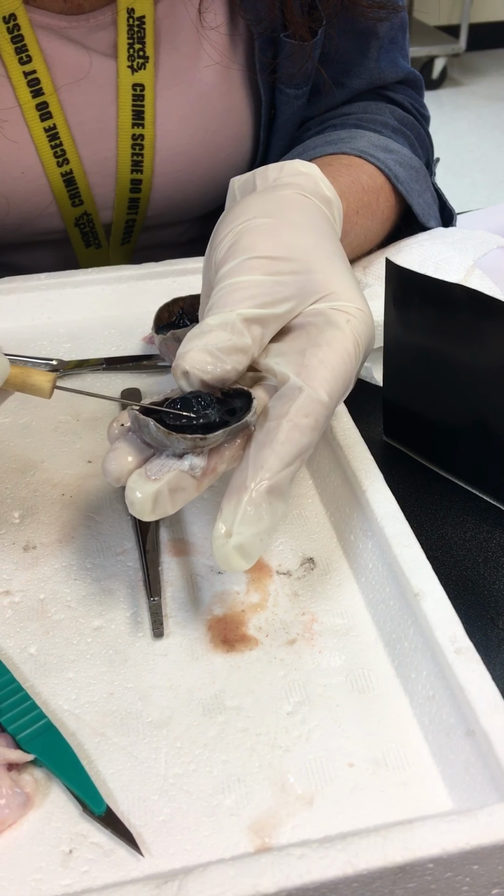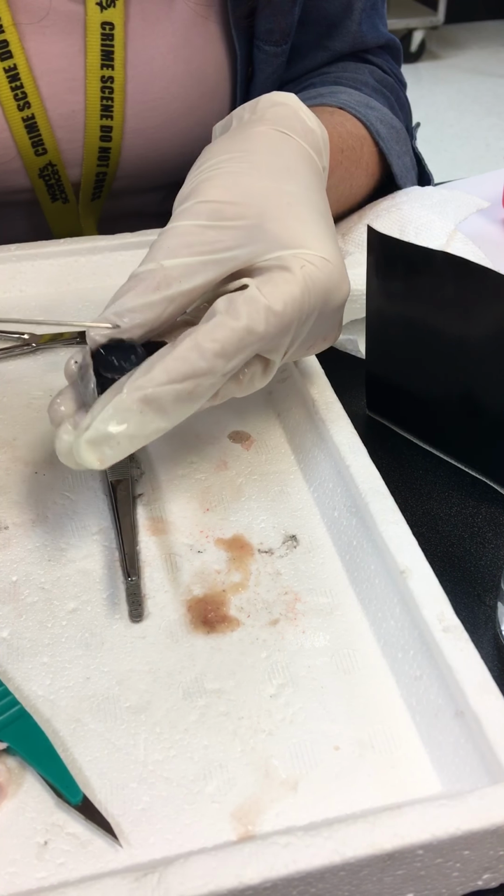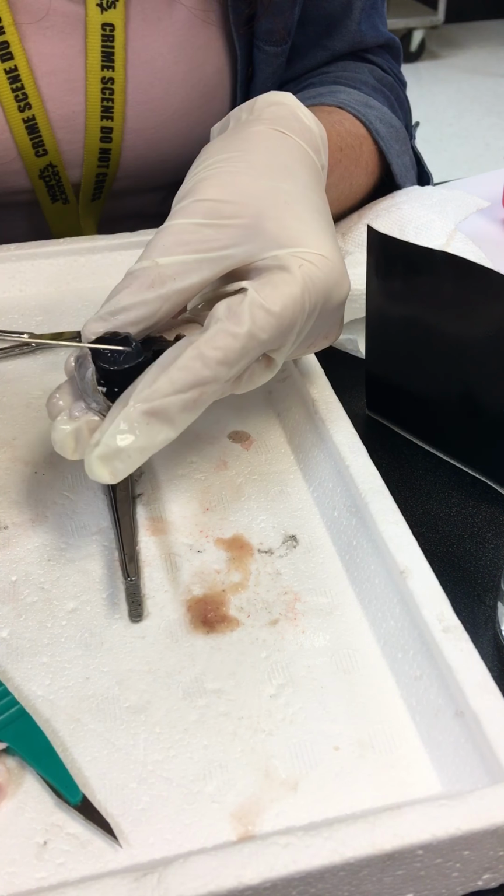If this lens is still attached, do you see any strings coming off this lens by any chance? Okay. I may have already damaged them. I was trying not to. If there were little bitty string-like structures, those would be the suspensory ligaments. Maybe because this is fresh, I'm not able to do it for some reason. If this was a preserved specimen, it might be a little more dried out and they might not be quite as delicate. Okay, but this here in my hand is the actual lens.